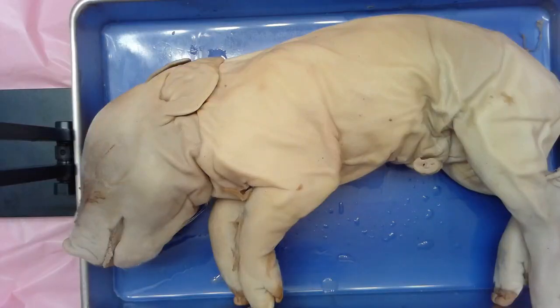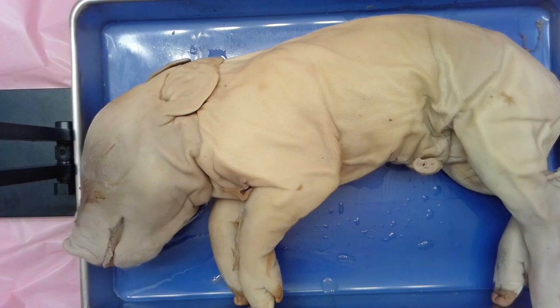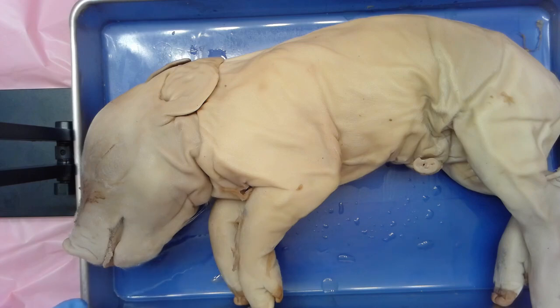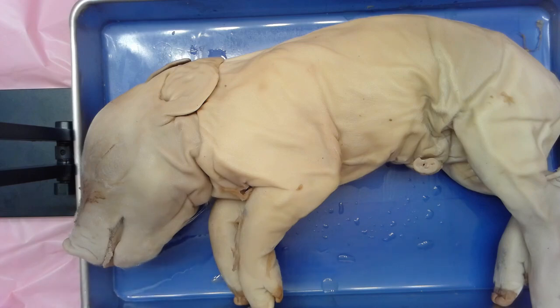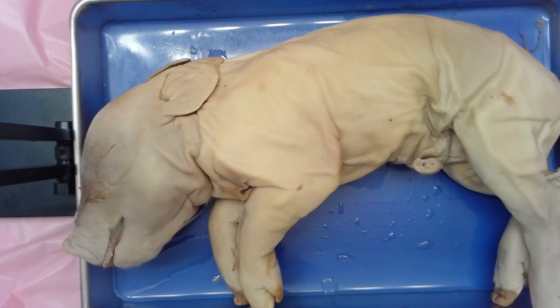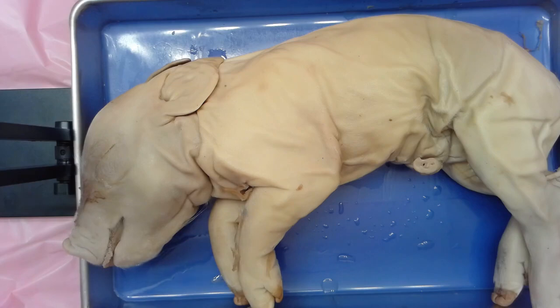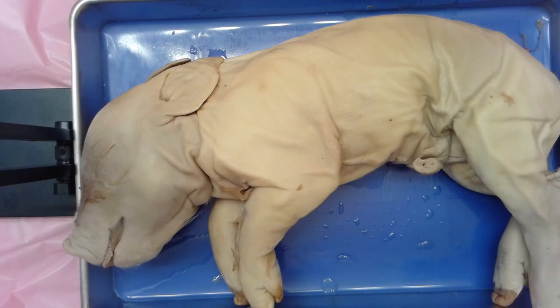We are starting our fetal pig dissection, and the first thing we want to do as we start talking about learning anatomy is identify some directional terms that will help us give reference points as we describe how to locate certain anatomical structures.